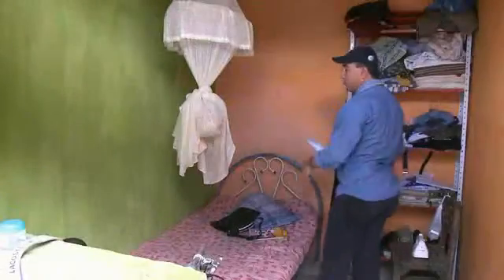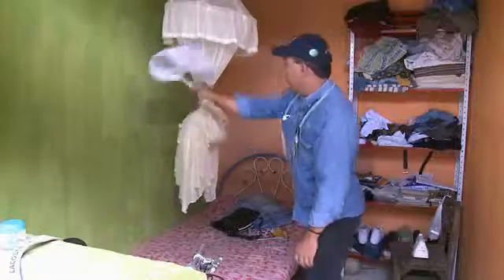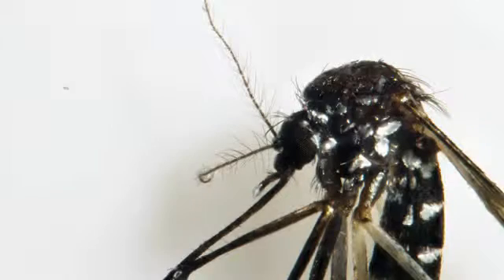This video covers the general techniques used for hand collection of adult mosquitoes. These techniques can be used for human landing collection and indoor or outdoor resting collection. Depending on the vector species being monitored, there might be slight variations in the techniques described in this video.